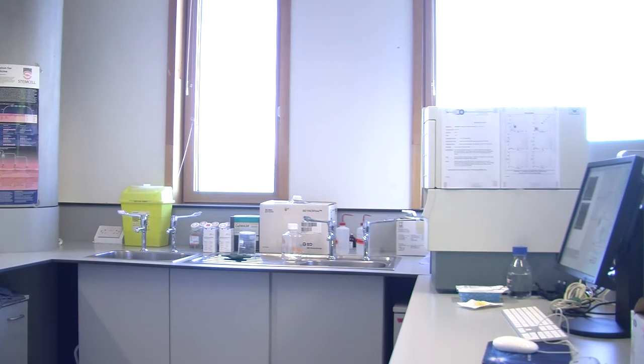So the isotype, sorry, say that again? Yeah, so the isotype is effectively the dust on the carpet. You're seeing how much carpet fluff is sticking to it. Because if a cell has 10 sticky spots, and it takes up 10 isotype controls, when you put on your actual antibody, 10 of your actual antibody will stick to those sticky spots. But then you might have 40 of the protein, so you get another 40 binding to the protein itself. So you have 50 fluorescence with your antibody, and 10 with your isotype control, because you've got 10 sticky spots.